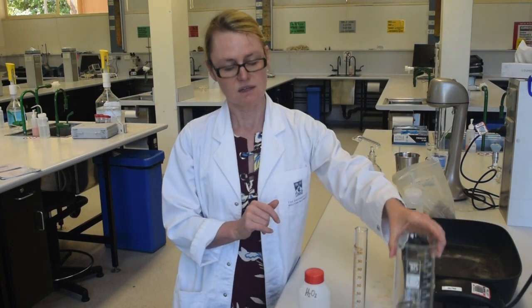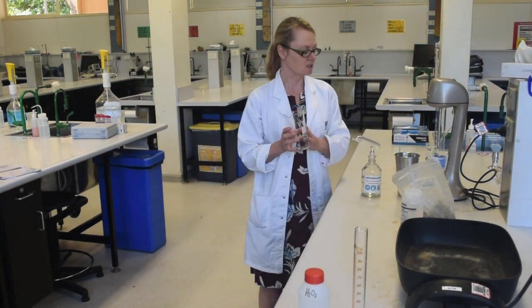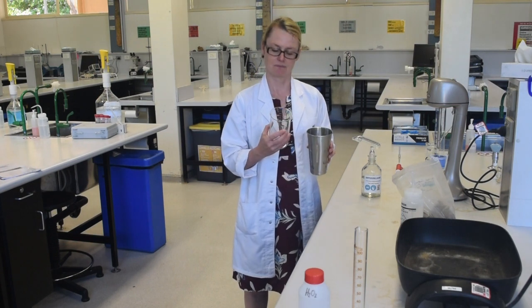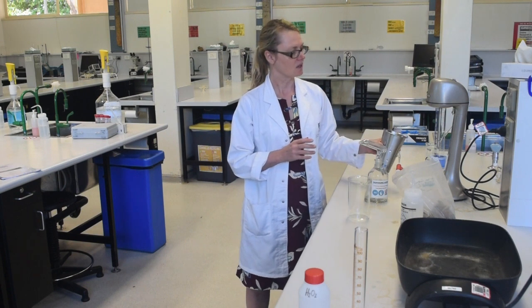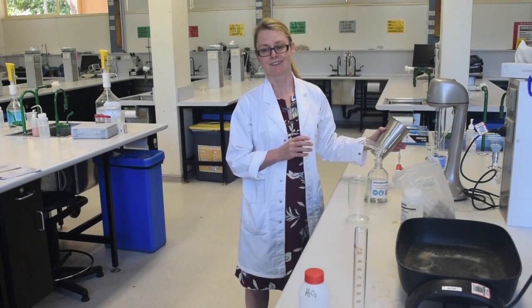Once this is completed, the next step will be to pour it into a milk shaker cup. You'll also have to add some dispersing agent before then mixing it up using the milk shaker for a set period of time.